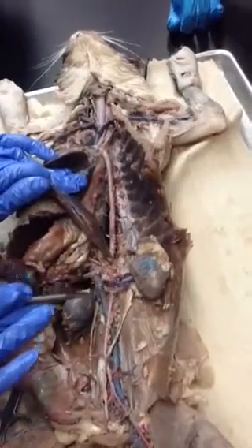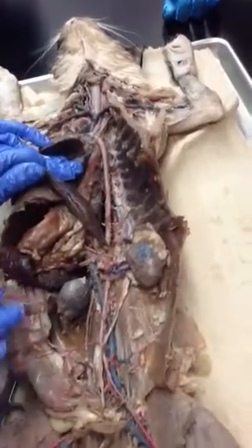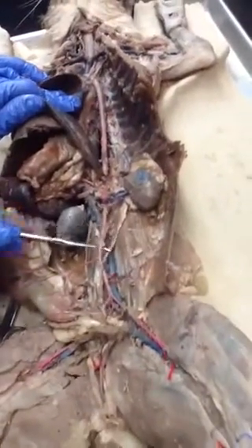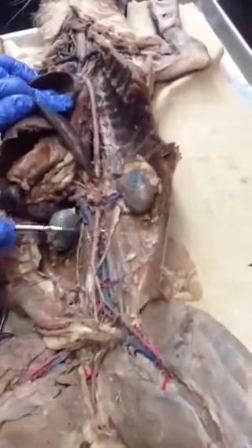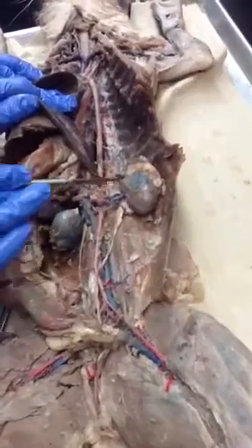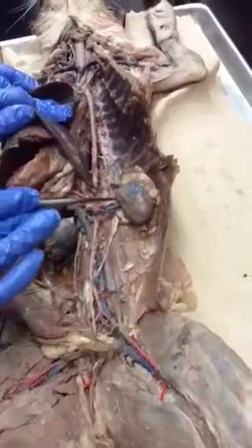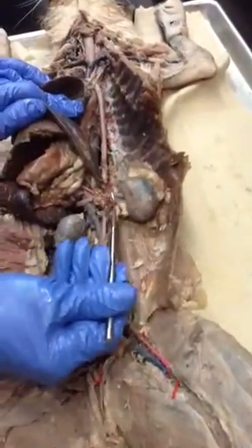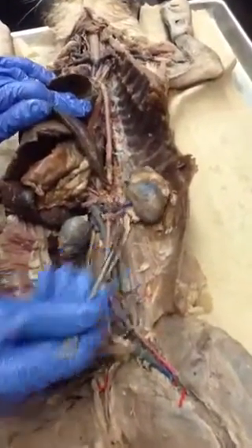Inferior to the diaphragm, still the same vessel, now it's called the abdominal aorta. We're going to see a little branch going off to the kidney as the renal artery here.